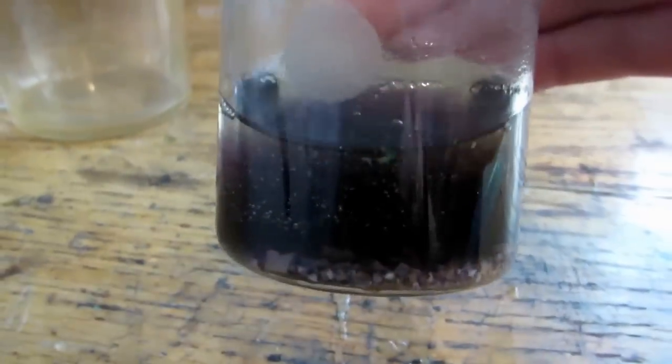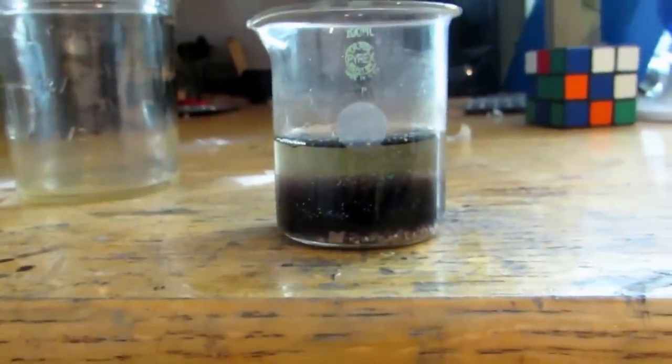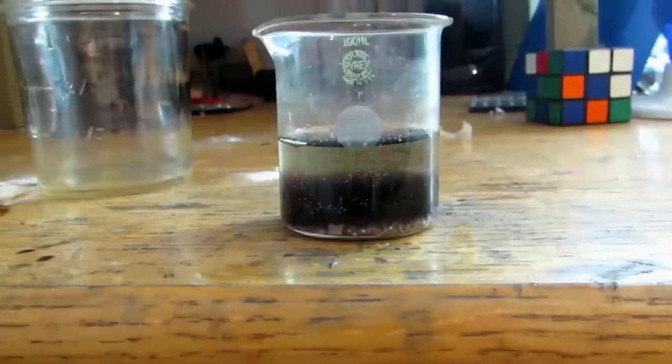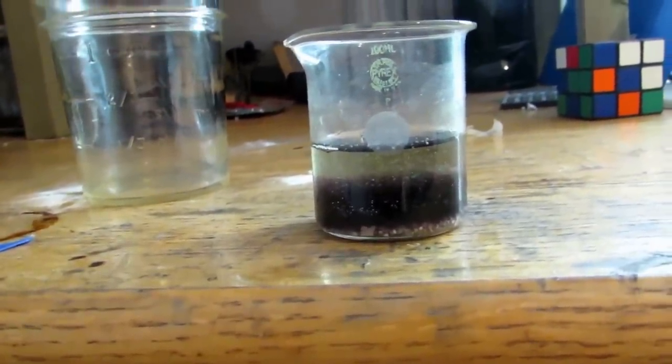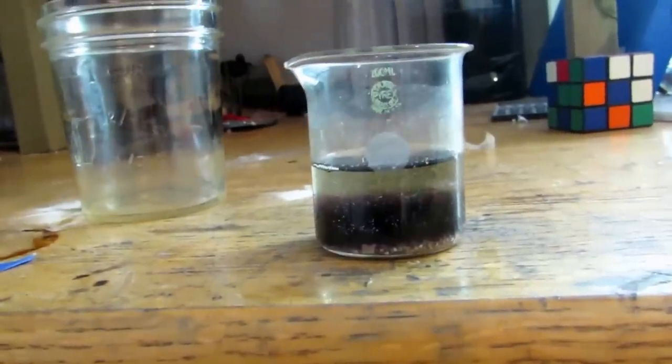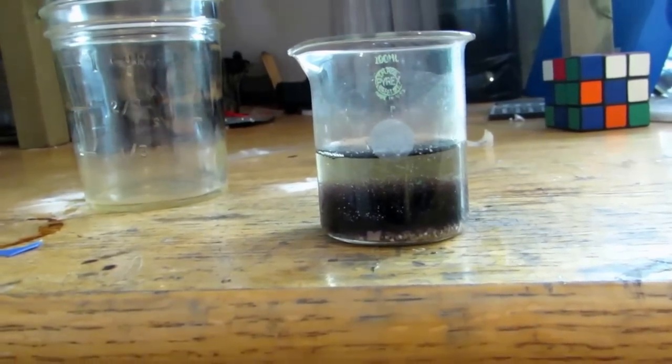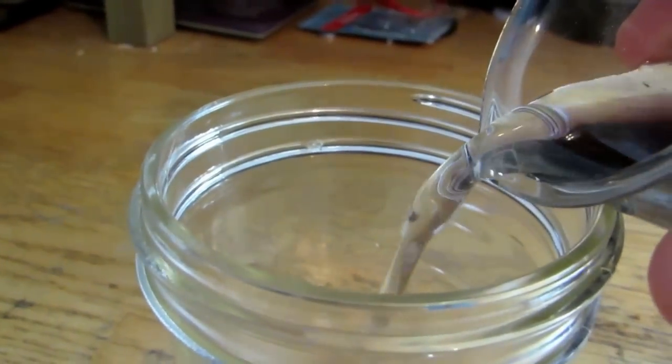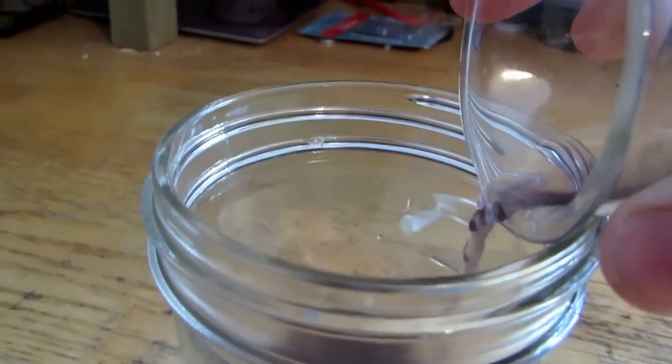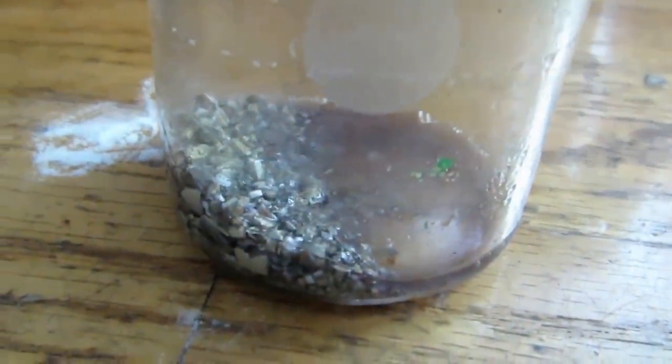Okay, so it's been about a week, and you can see that the hydrochloric acid is starting to get dirty. That's because it's dissolving other things. It has settled out though, and so that all the whatever is dissolved in it is on the bottom, where all the monolithic ceramic capacitors are. So, right now we mainly have nickel chloride in solution, although it is obviously dissolving some other things. Now, since there's no more bubbling occurring, we can safely assume that all the soluble material has been practically dissolved. So, what we're simply going to do is decant off most of the mixture, so that we're left with our palladium and with some silver in it.